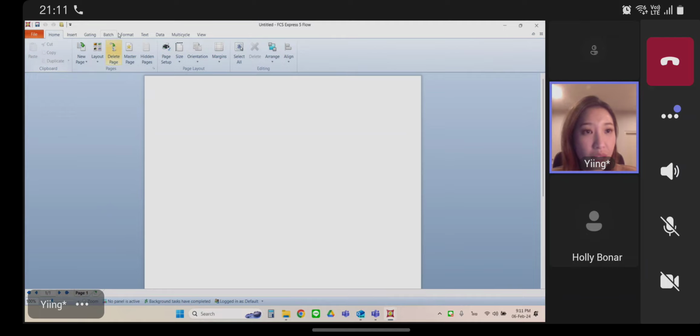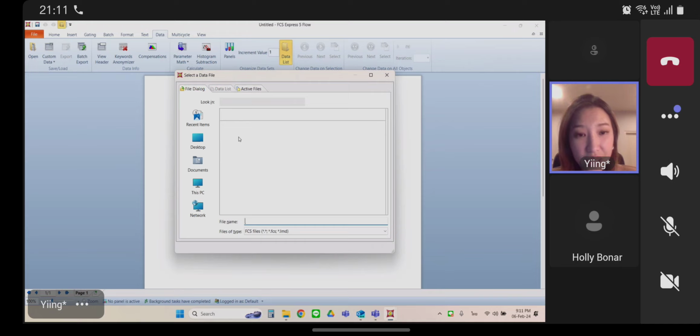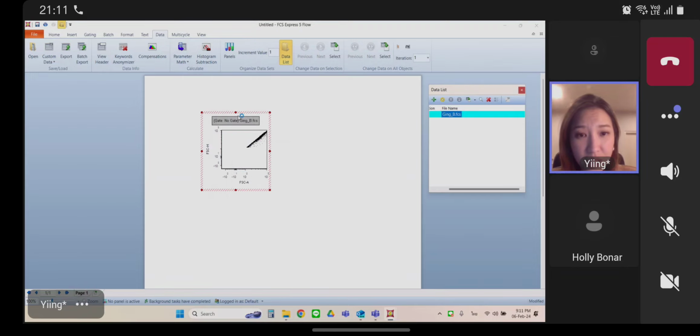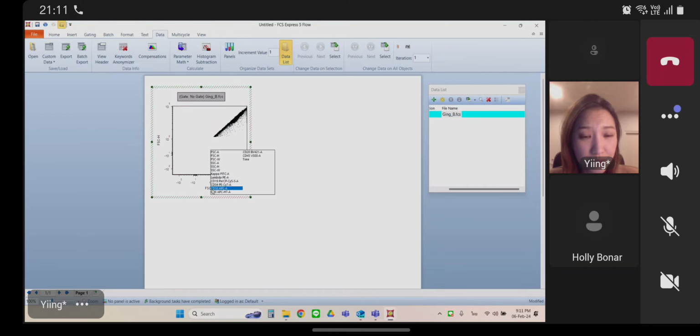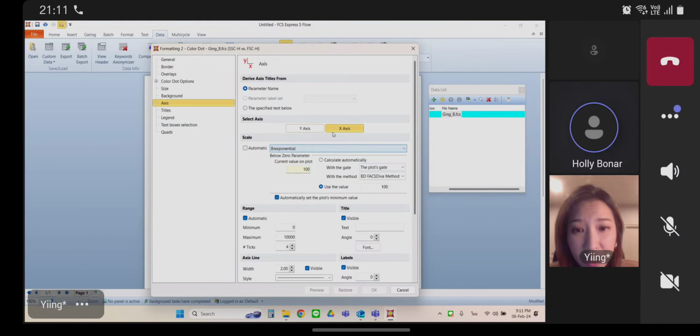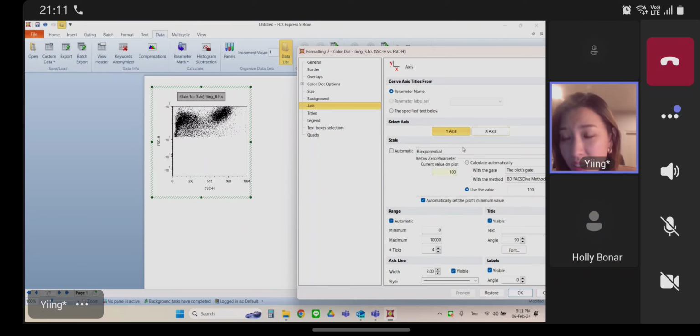When I create the template of LSR, I create, insert the data to the template. One color dots. Yeah, so if you look at your parameters, you've got more parameters there. Remember we counted 4 and then you had 6 there. Right. Yeah. Wrong parameter.